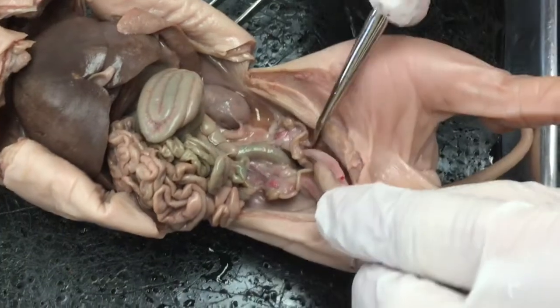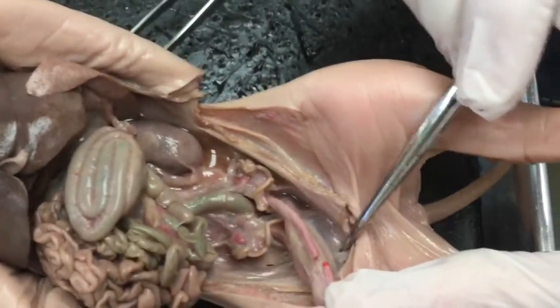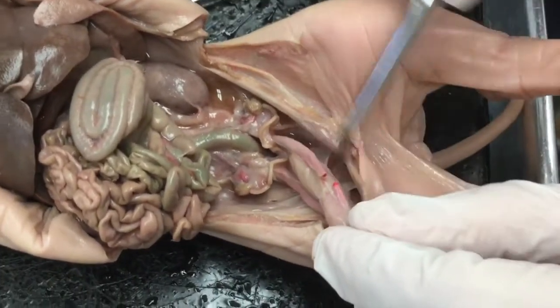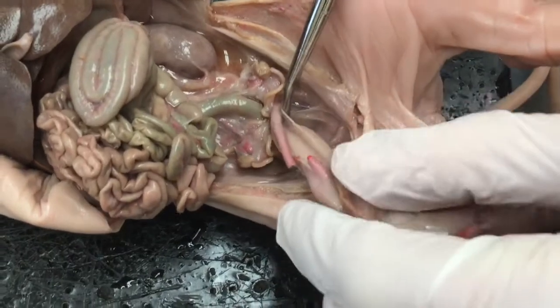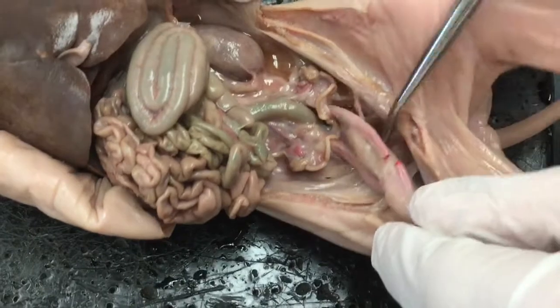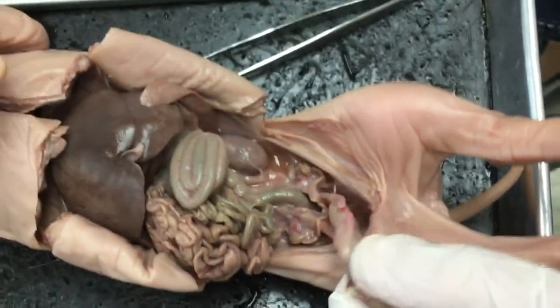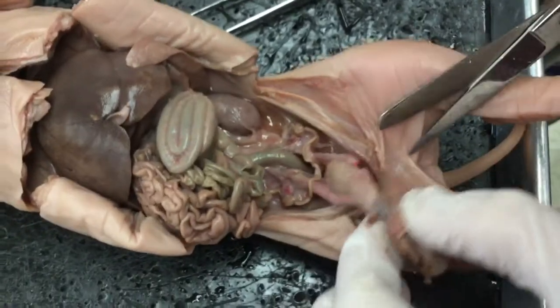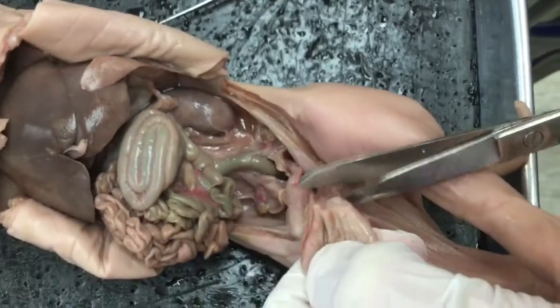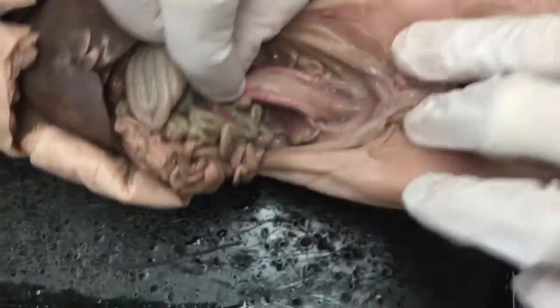So another thing I want to point out is behind the umbilical cord, you also have this clear film that you can penetrate, and you can kind of poke through there. Behind here, we're going to be able to see the urethra and the vagina. So I'm going to basically separate those two out. Scissor to do that. So when I cut that, it allows me to open up this completely.